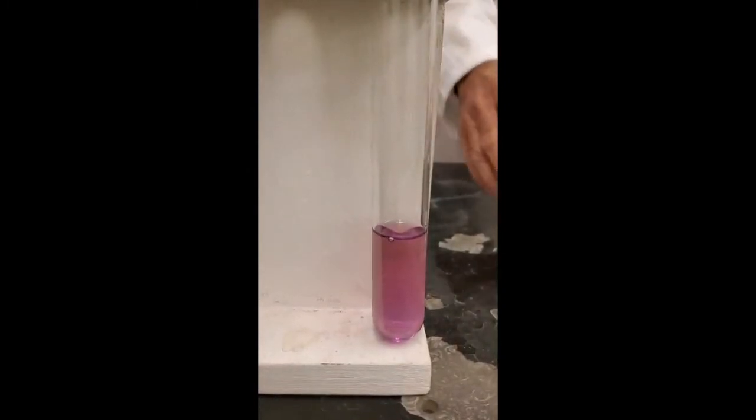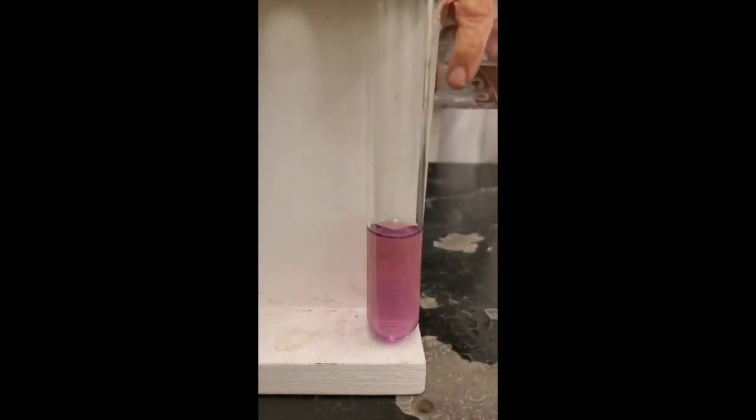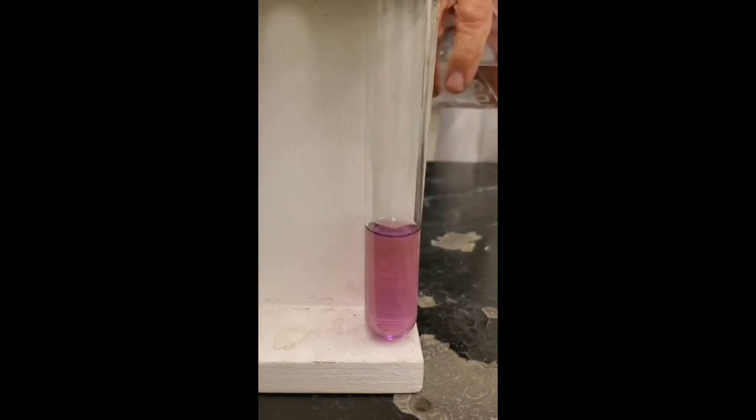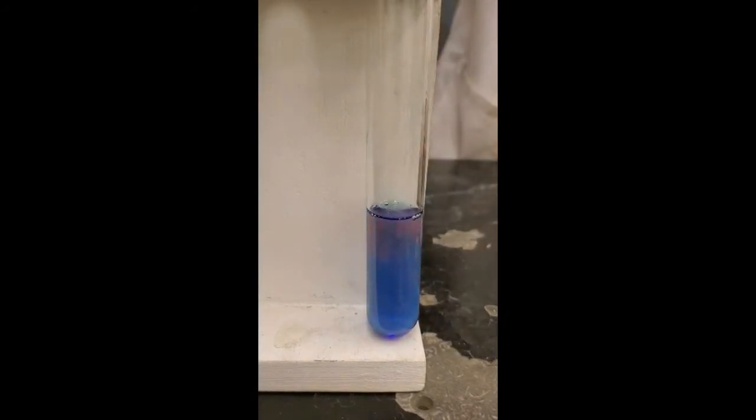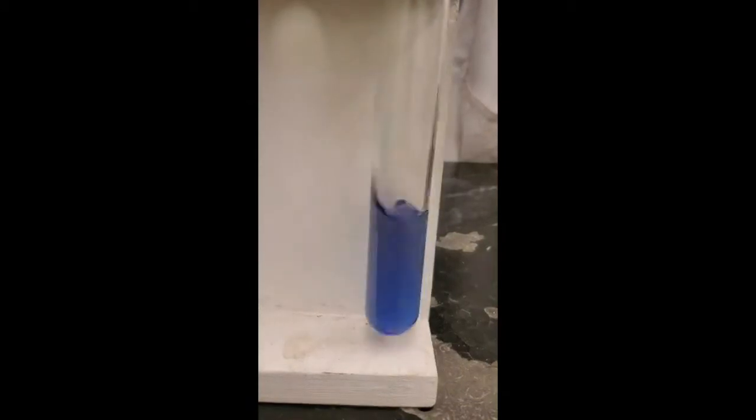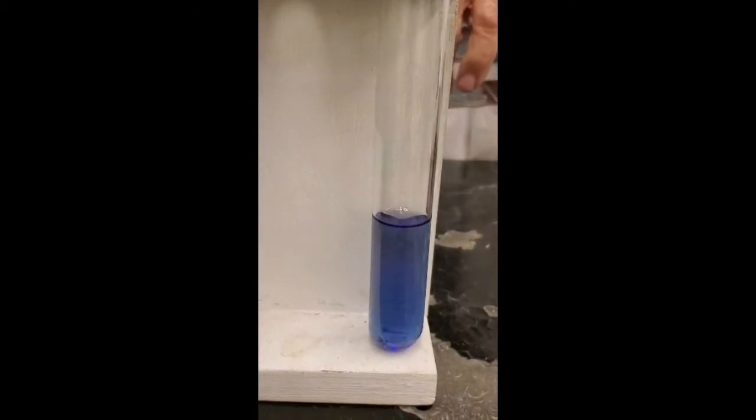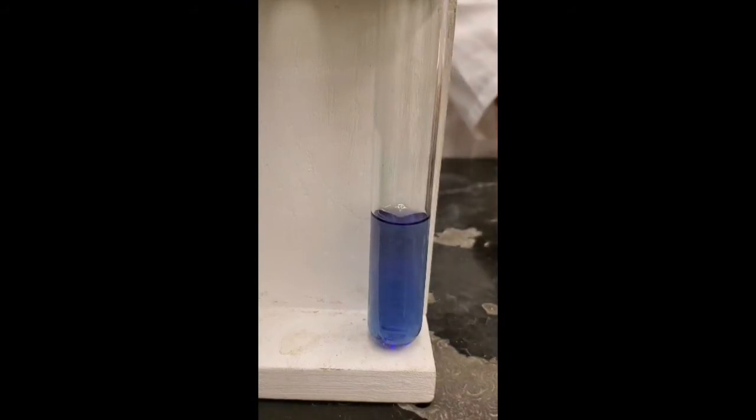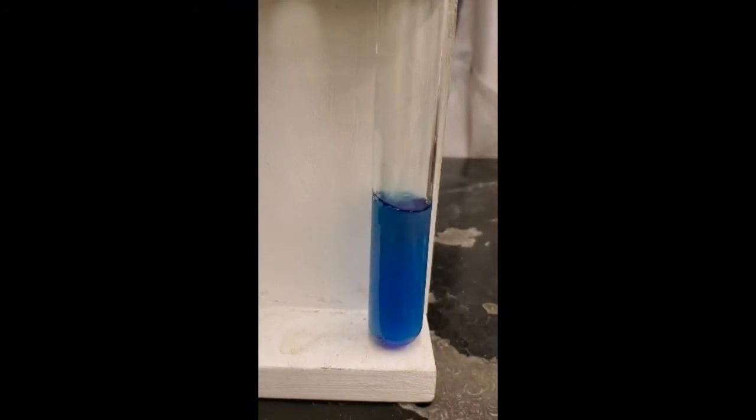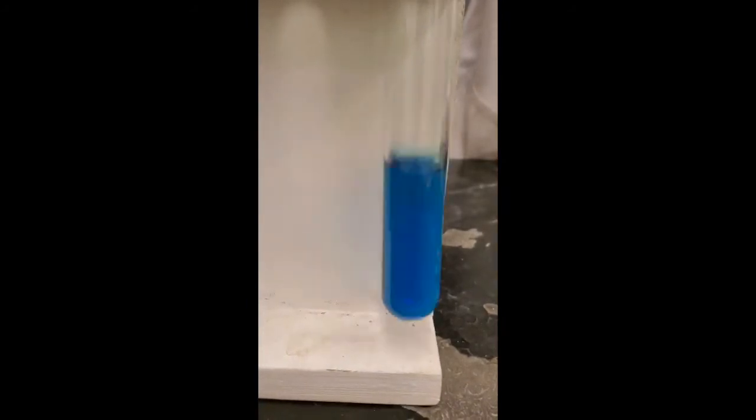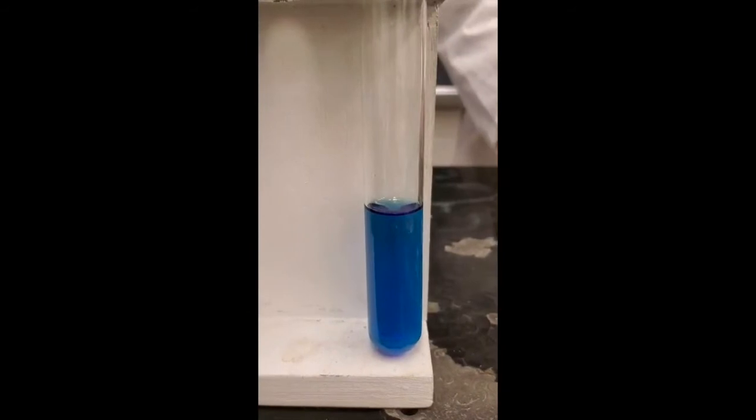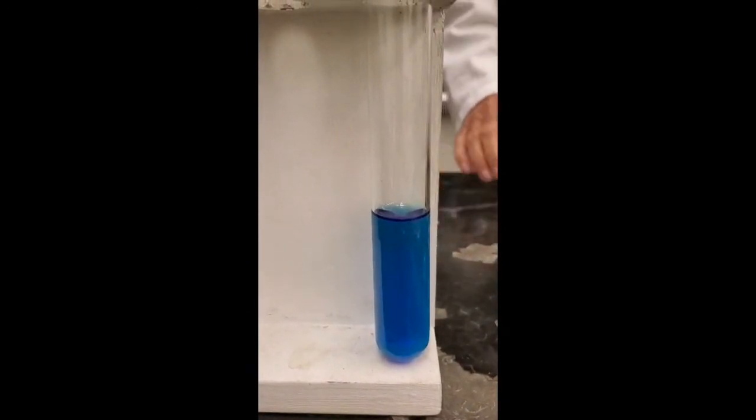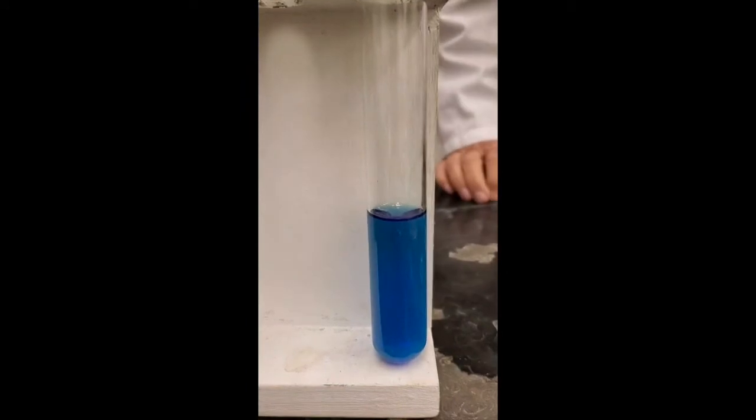Red and blue together make purple, right? Let's get all the water molecules out and get the tetrahedral complex. It'll be blue, I believe. You see it turning blue? Now it's more blue in it. Let's add some more. Yeah, that's pretty blue now, isn't it? And notice it's more intensely colored, too. There's a reason for that. It has to do with removing the center of symmetry. If I have enough time, I'll tell you in class about that and why that is. That's pretty, isn't it?